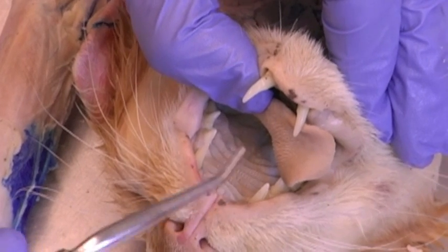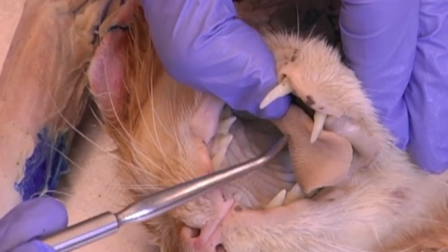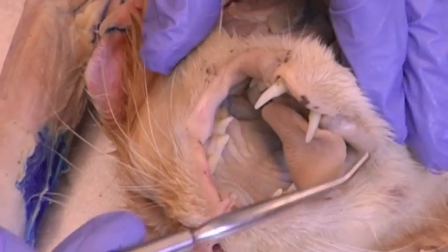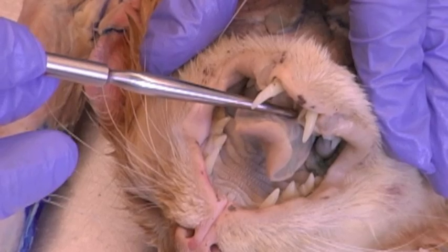At the oral cavity, we have the filiform papilla on the anterior surface of the tongue, the hairs used for grooming, and then the lingual frenulum, the tissue that connects the tongue to the floor of the mouth.